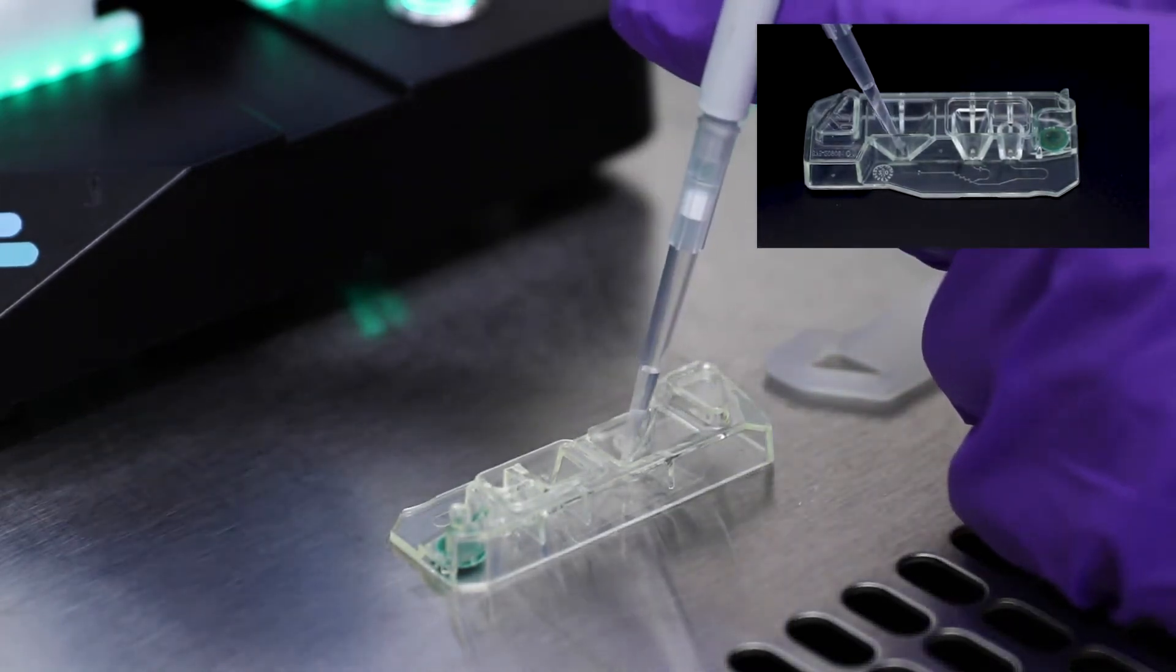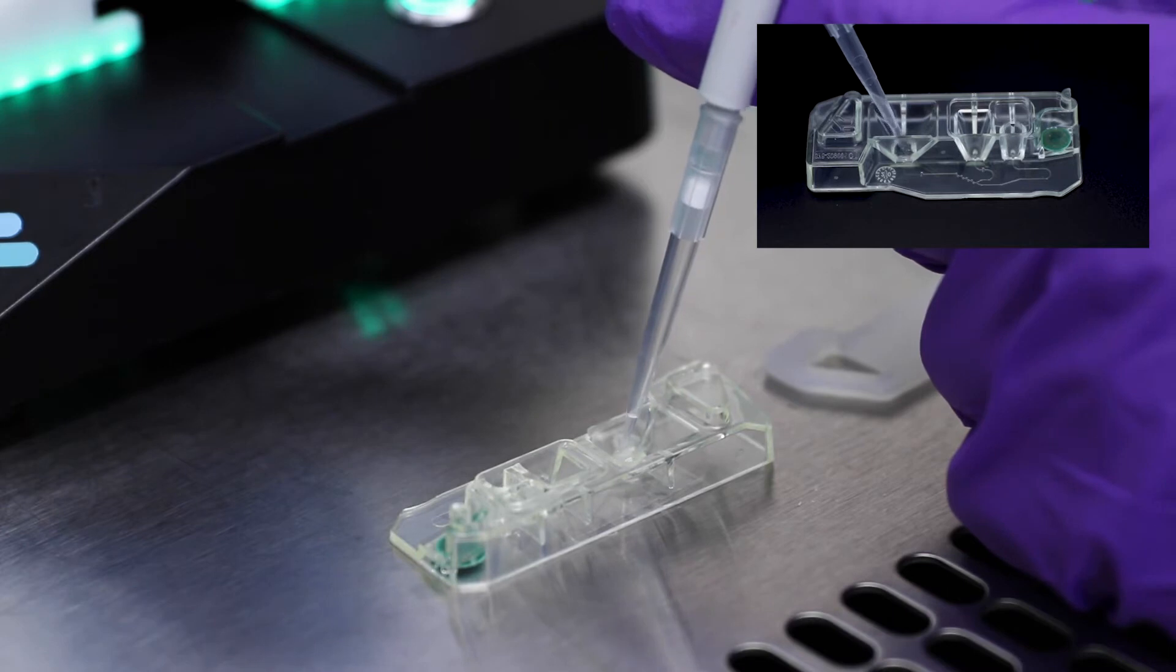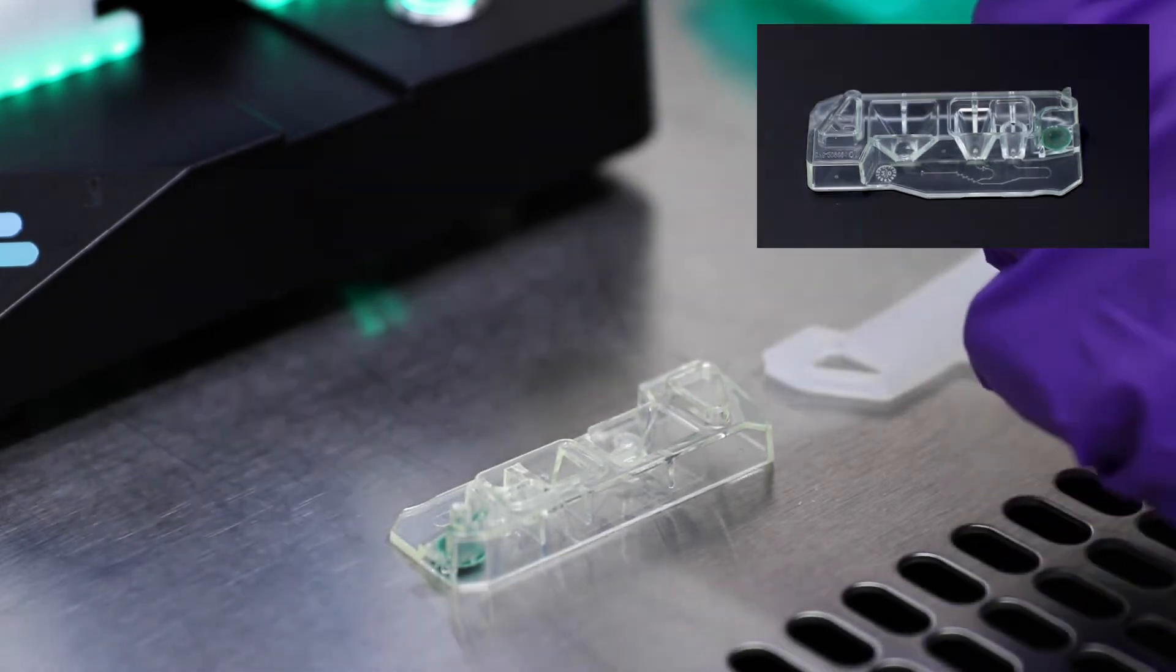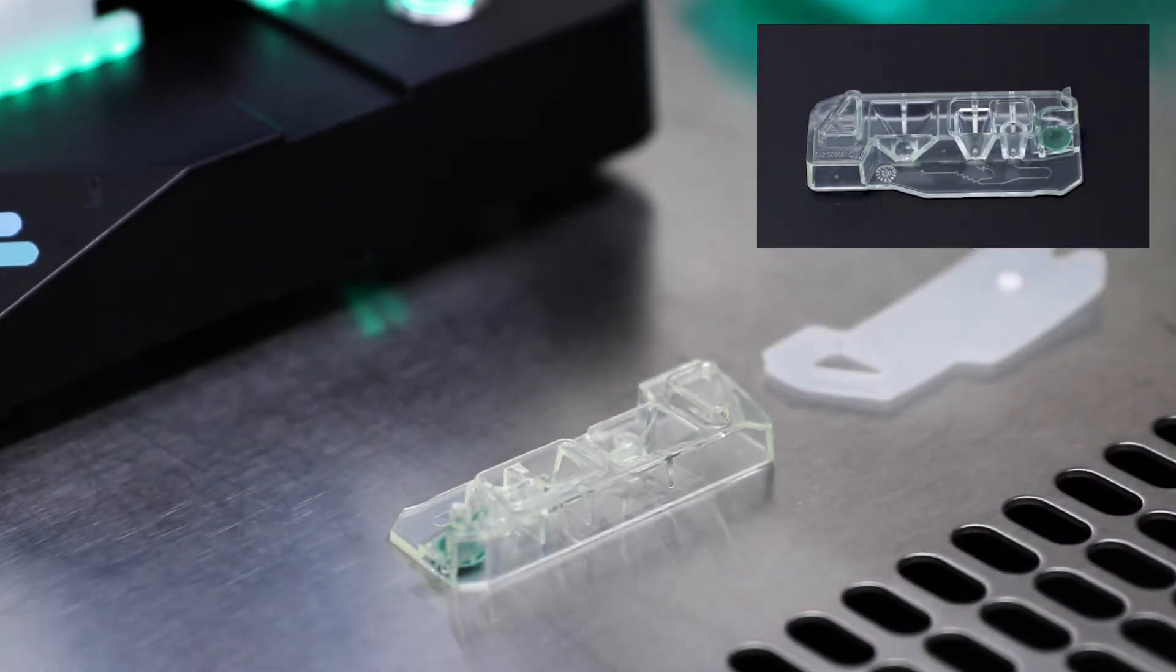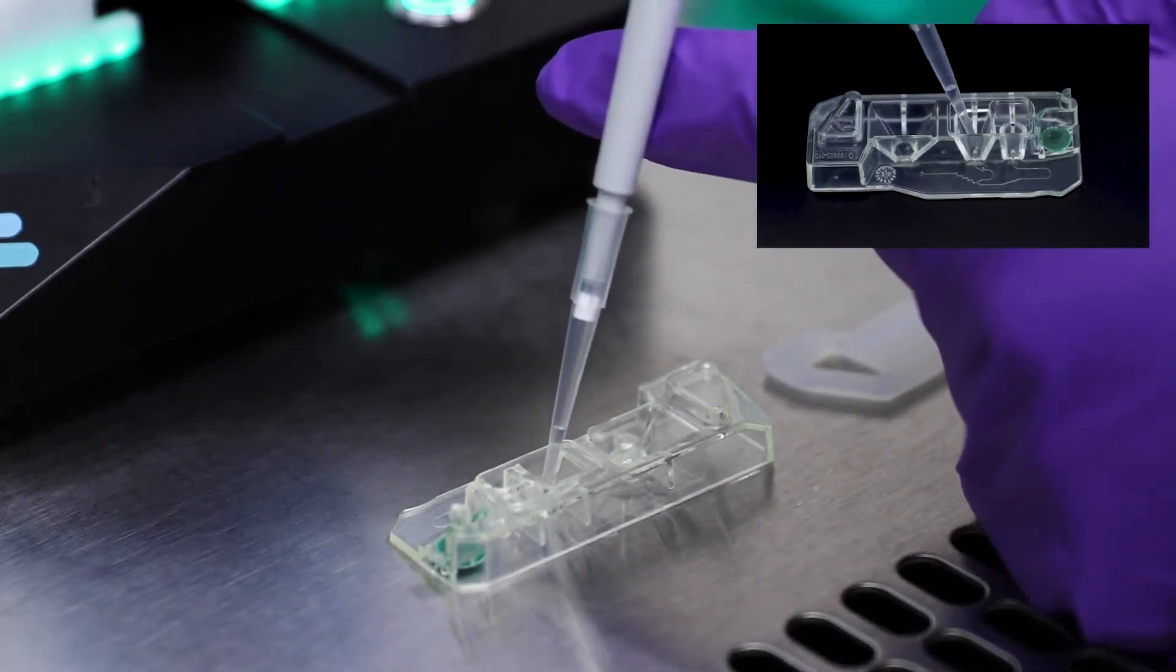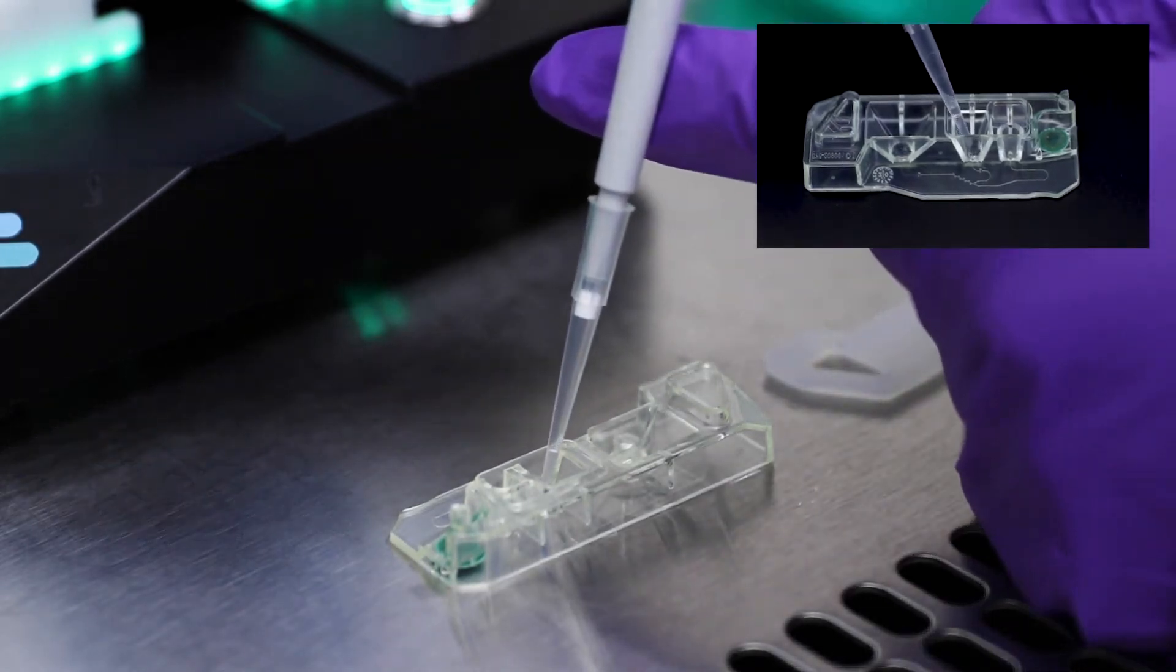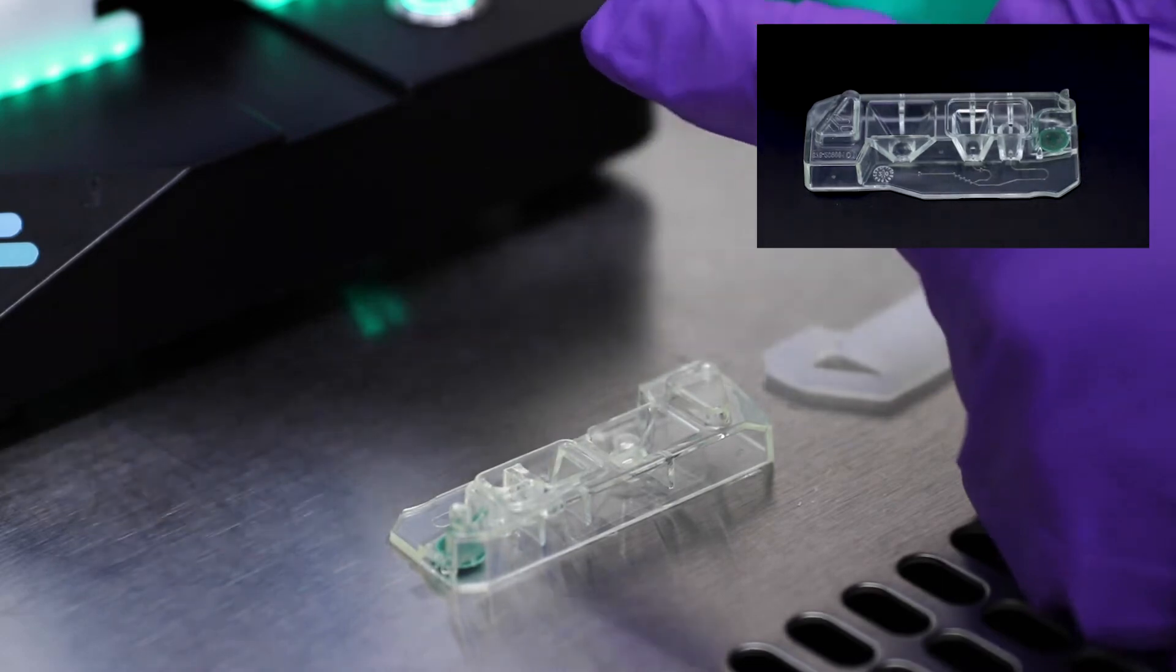Start by dispensing the required dilution buffer into the largest well, well one. Next, dispense the aqueous phase containing the nucleic acid in the appropriate formulation buffer into the middle well, well two.